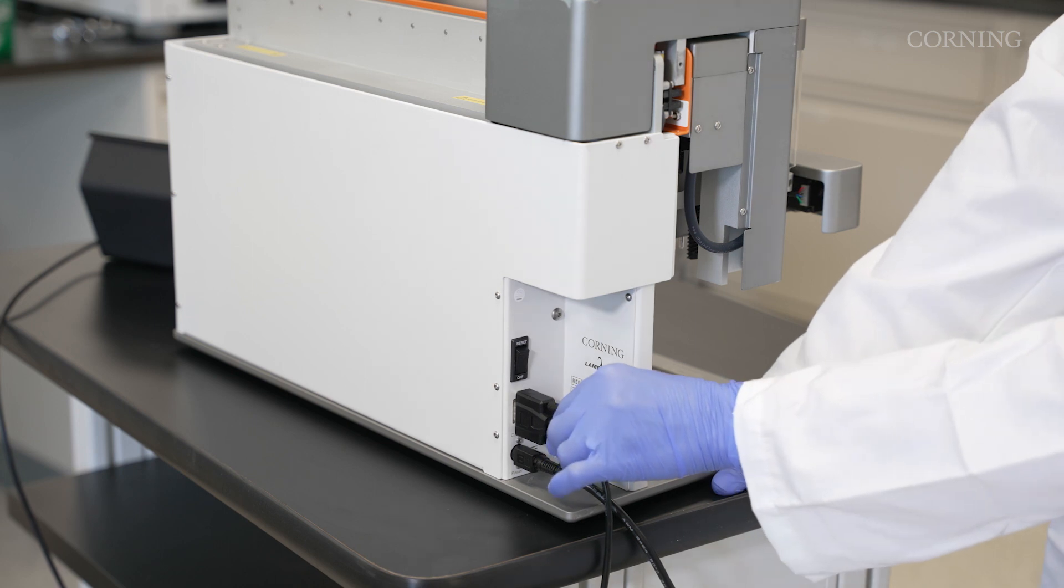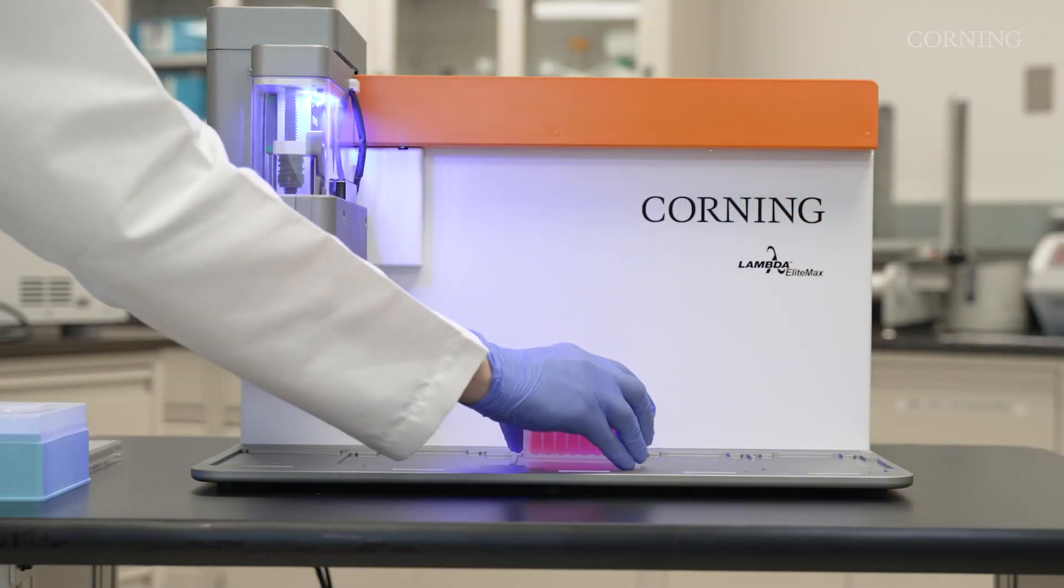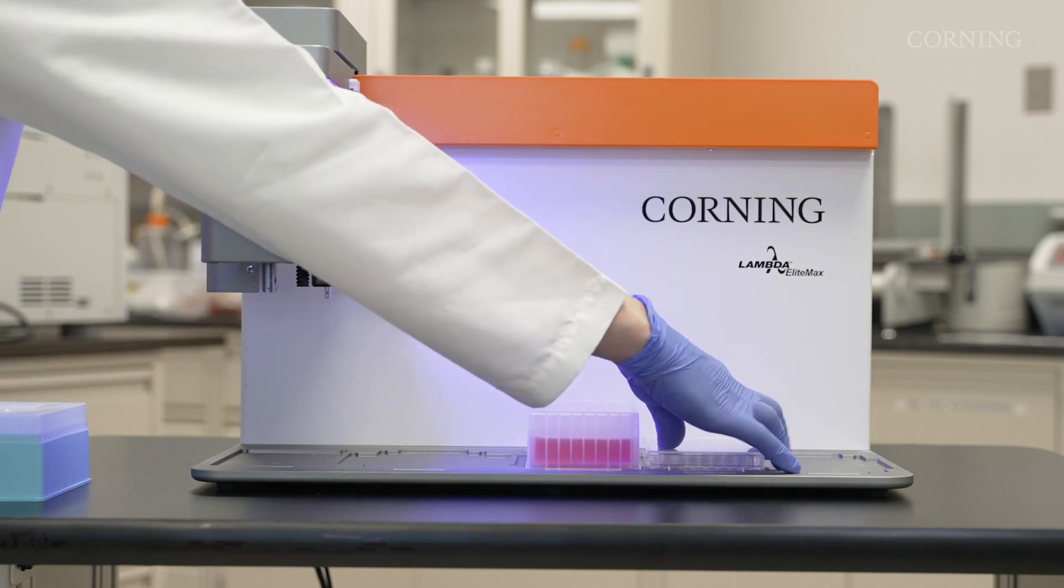4. Toggle the power switch from off to reset. 5. Place the consumables on the deck in landscape or portrait orientation.